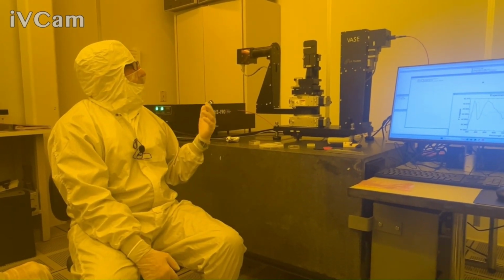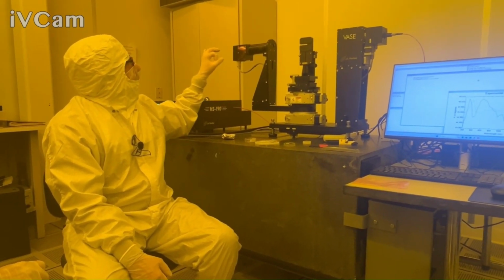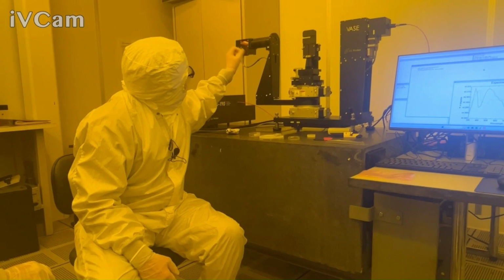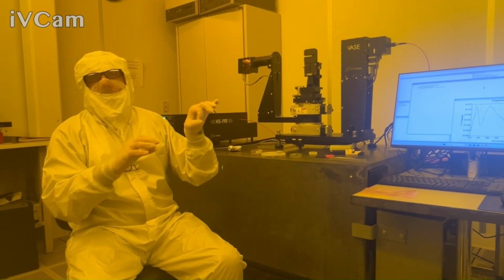And so that's where our beam comes in. We can move it to white light here in a second, I guess. But the beam is several millimeters right now, at least. And then on this side, there's actually an aperture with a little pin. I can close that iris if I want to capture some of it. But normally for ellipsometry, we're not trying to collect the full beam.